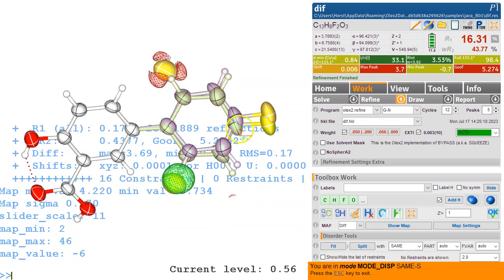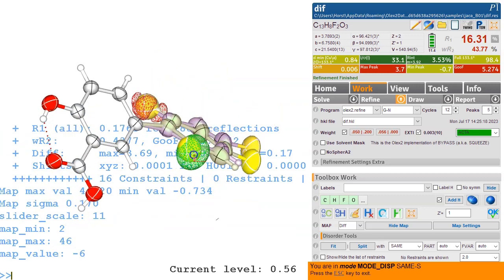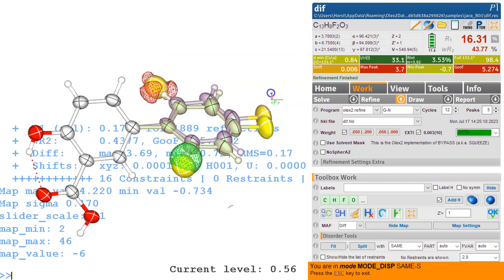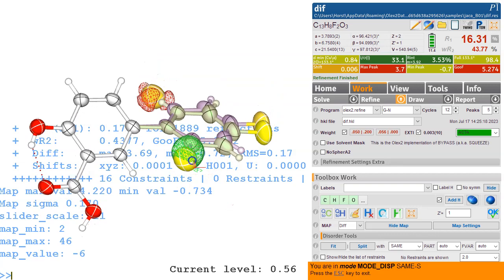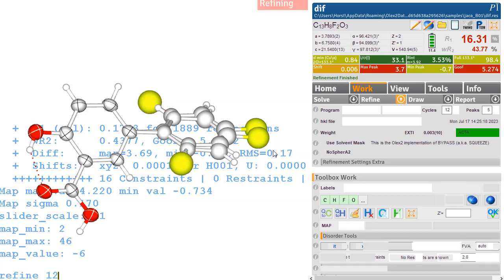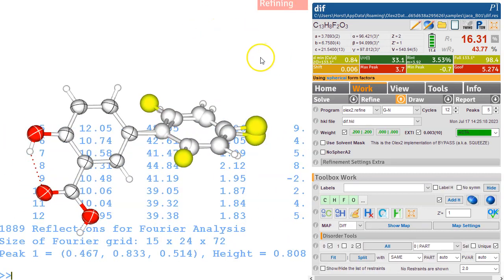Control M, we can switch that on in the ways. It'll be a bit too far over. You see, the problem is this is going to be right in here, but if we put this further over, then these carbon atoms will be on top of each other, and if that happens, then OLEX2 is going to end up deleting some when they're too close. So let's just try to align this in this way, and that's probably good enough. And refine 12 cycles and see what happens.